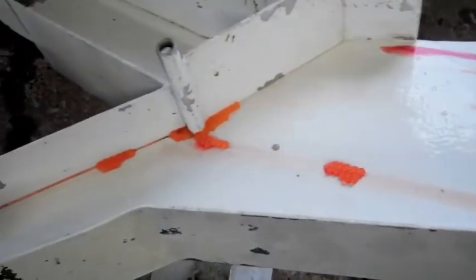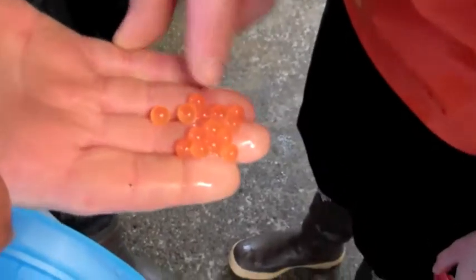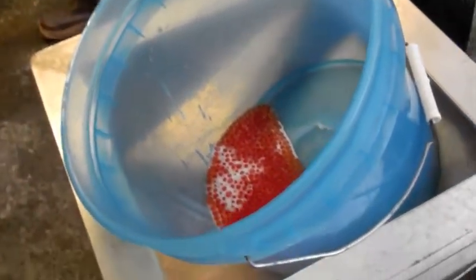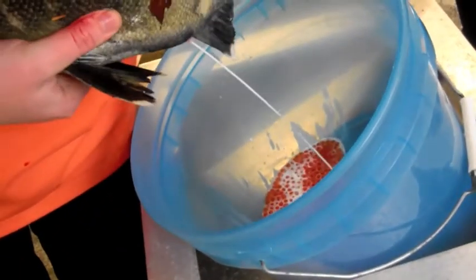If they're partially green, that upper part of the skein develops last. These eggs have already been exposed to water, so they're hard — they're inviable. The micropyle has swollen shut. All these other eggs that are smaller and pliable, those are good viable eggs. There you go, that's plenty out of that one — it doesn't take very much, it's a drop. Get that other guy and do the same thing. And that's plenty. You've got a little extra genetic mix going on there — that's what I like.